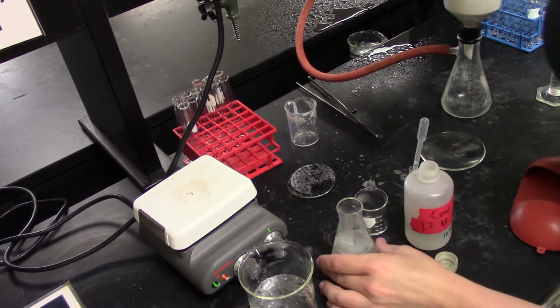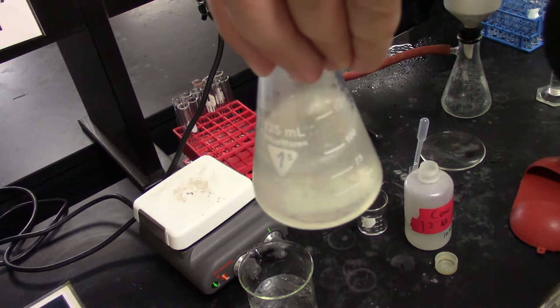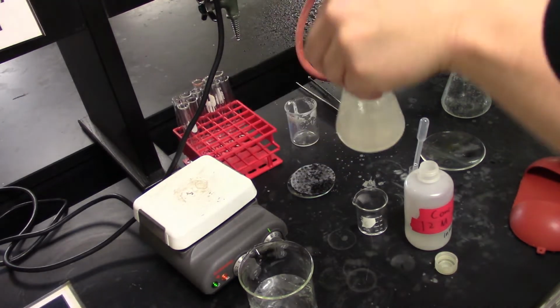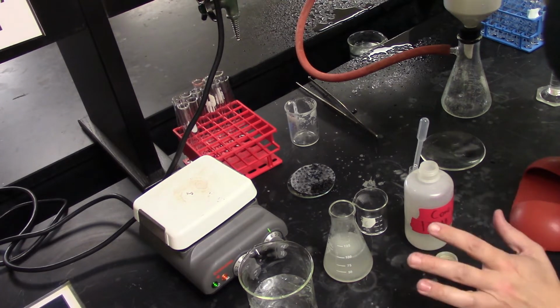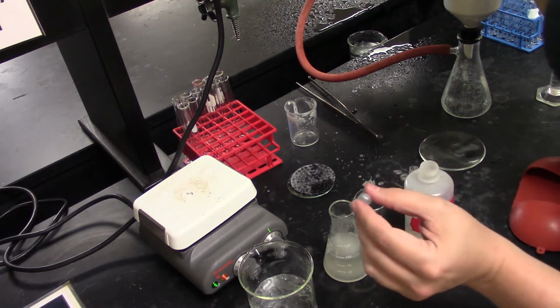Now what we're also going to have to do when we're doing this is neutralize out all the unreacted sodium hydroxide from earlier. So it's not like this immediately occurs. We have to give it a good swirl in order to make sure we've got everything reacted away. But now I'm getting the snow globe effect, and these flakes that are forming here are actually the palmitic acid that we're trying to isolate. So let me get a little bit more acid.